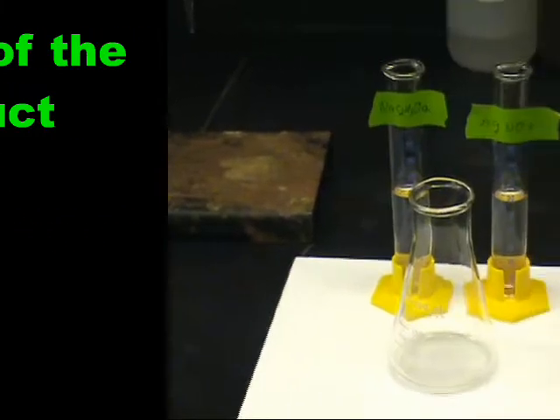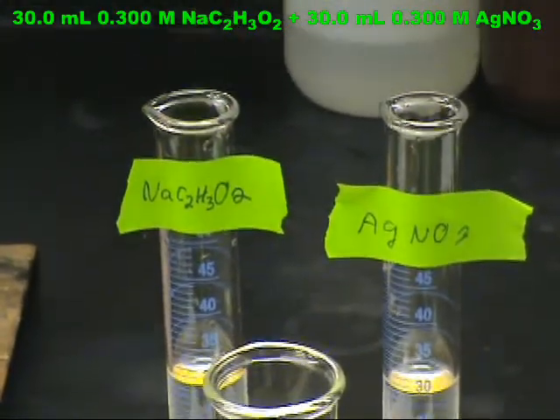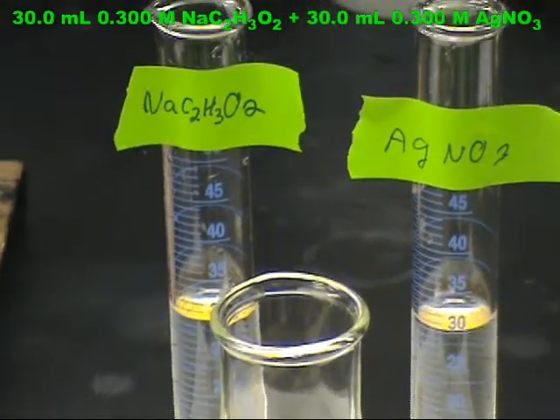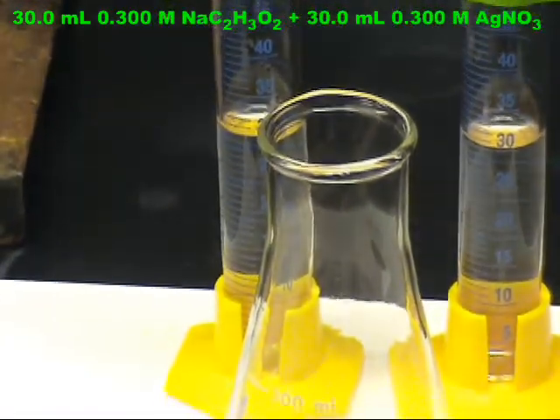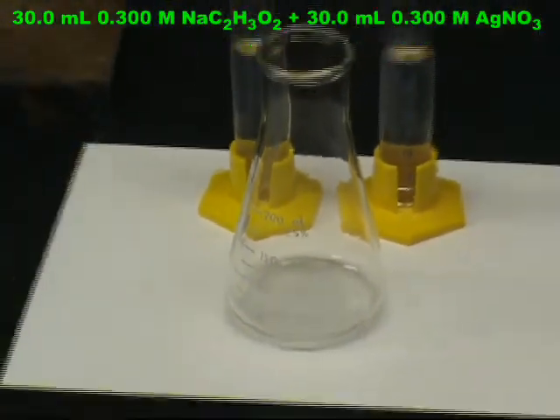In this lab, we will determine the solubility product constant of the sparingly soluble salt silver acetate. First, you will measure 30 milliliters of 0.300 molar sodium acetate and 30 milliliters of 0.300 molar silver nitrate.